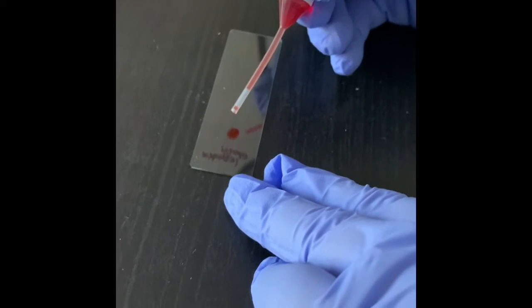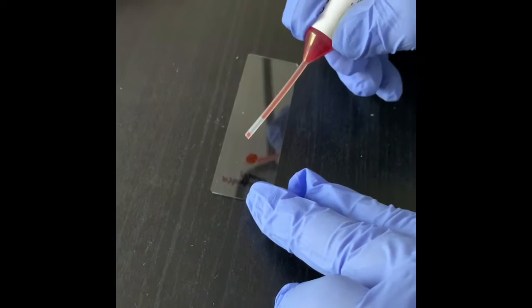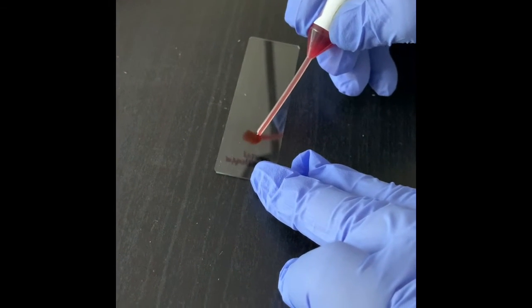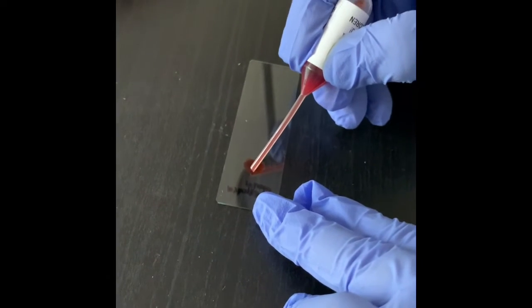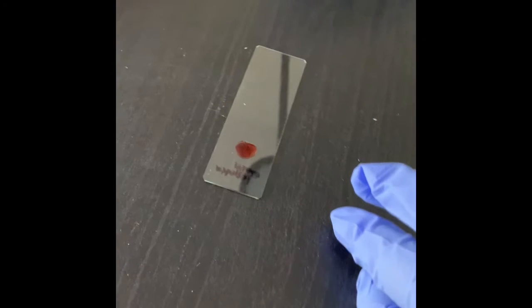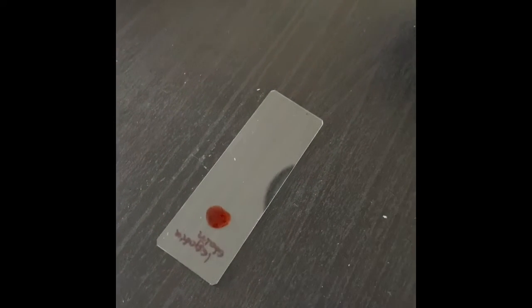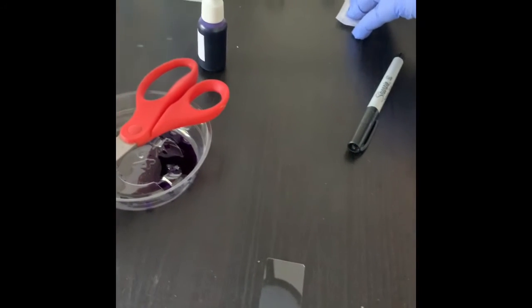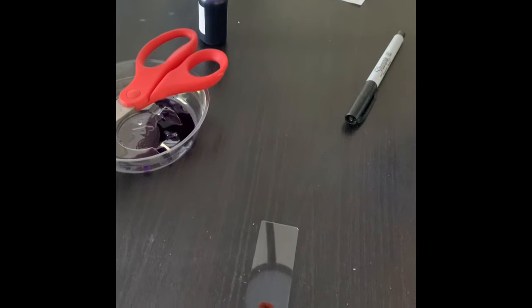Since I'll be using a cotton swab, I'm taking a little bit more because the swab may take some of the stain with it. But when we do this in the lab, we don't actually use a cotton swab. In that case, we take only a small drop of the stain. So now I'll take another sterile swab and take the swab from the tooth area. Let me do that.